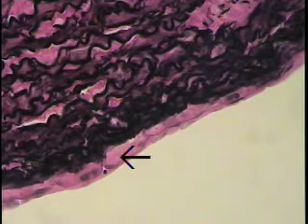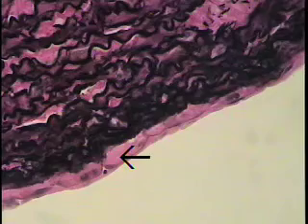Now, as we course through this thick vessel, what's important to note is the amount of elastin or elastic tissue in addition to the smooth muscle. What's staining now in that nondescript pink color, let me just get it focused a little more crisply, is actually smooth muscle.